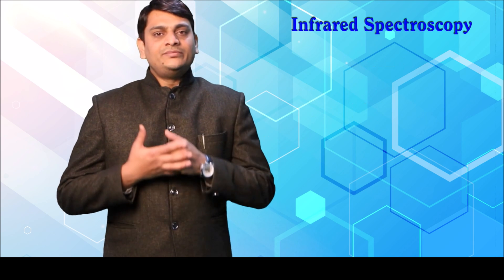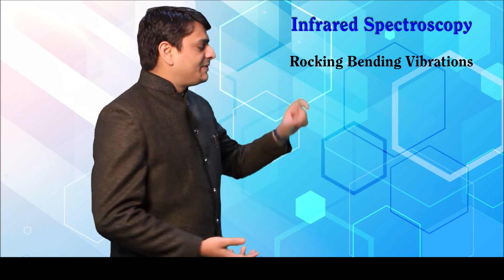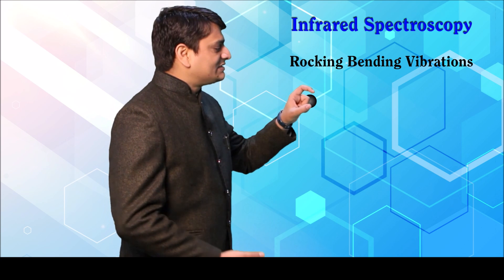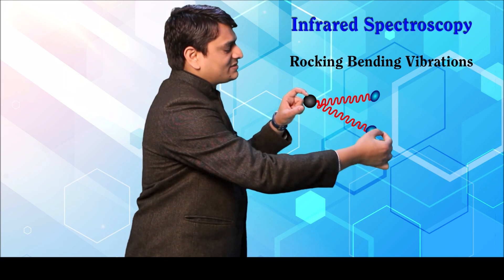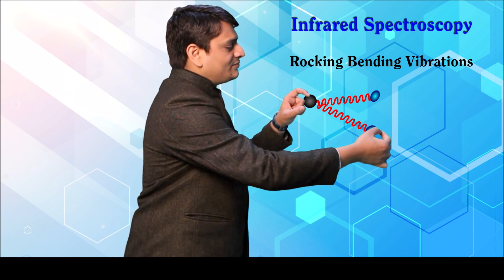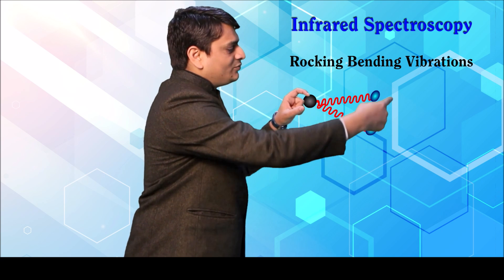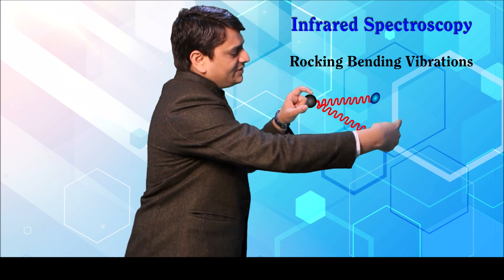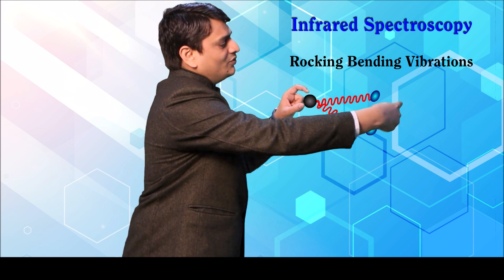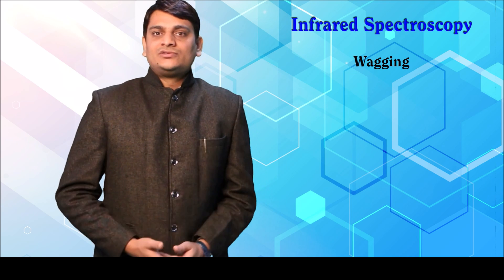In rocking vibrations, atoms of the compound are present with bonds connected. The movement of these bonds is in the same direction — both bonds move together in one direction or both move together in the opposite direction.